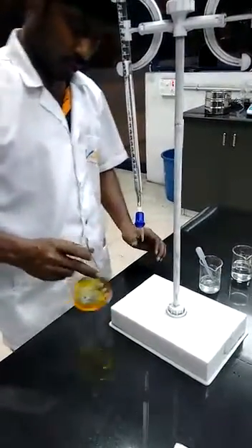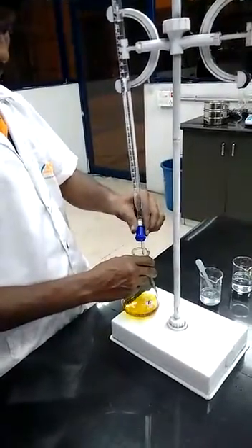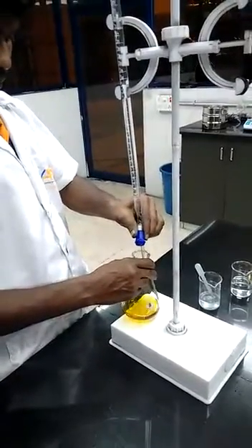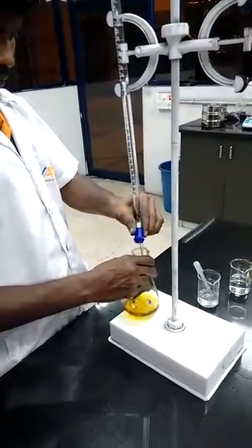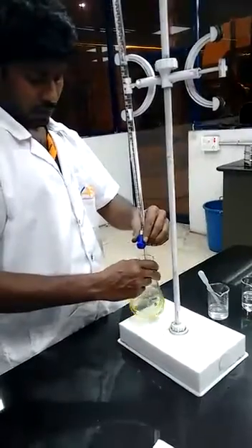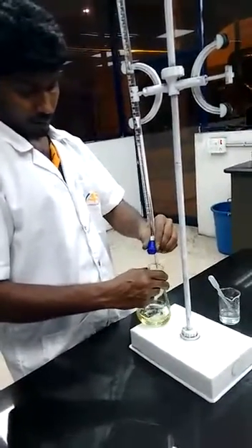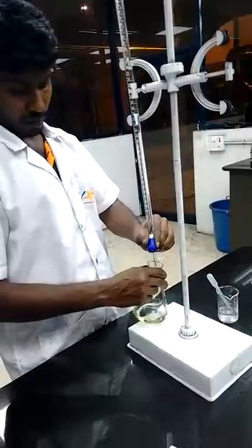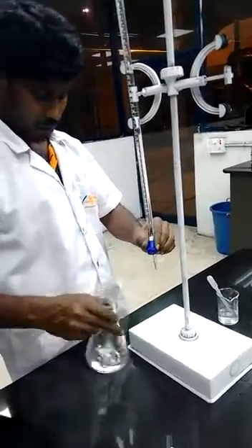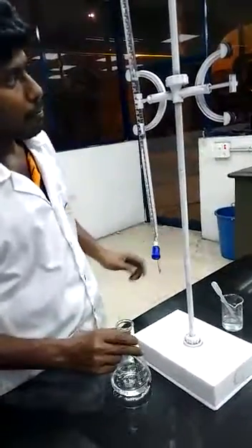Stir it well. Again continue the titration till the solution changes to colorless.